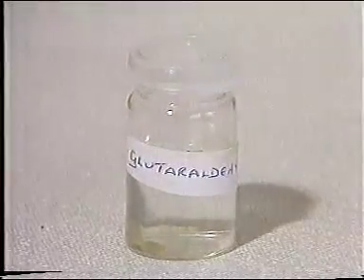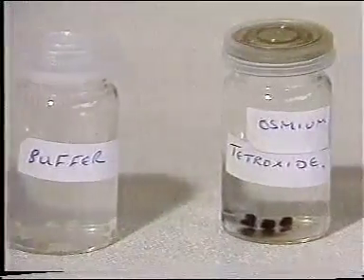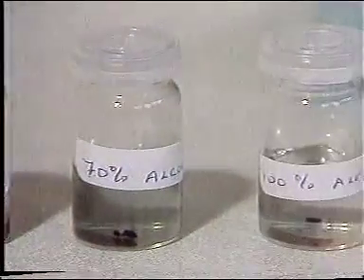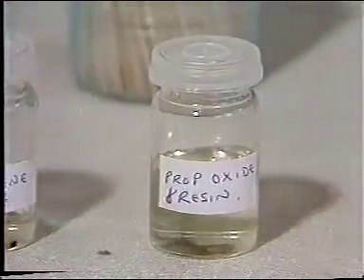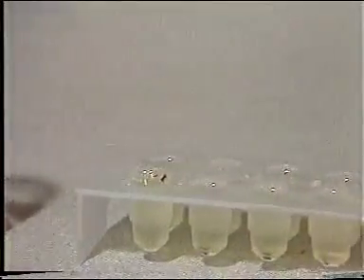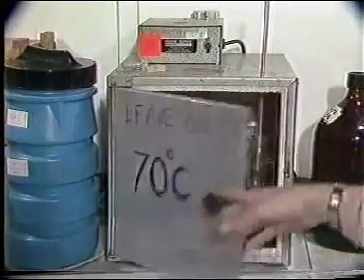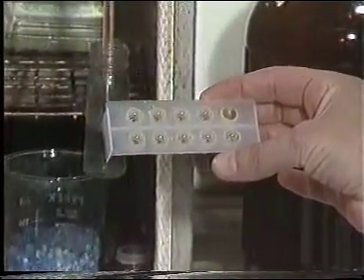Prior to using the second fixative, the tissue is washed in buffer to remove excess glutaraldehyde. Osmium tetroxide is then used primarily to fix lipids. The fixed tissue is then passed through alcohols of increasing concentration. Once dehydrated, it's transferred to resin. It's then put into a small mould and placed in an oven to polymerize. The viscous resin hardens and the tissue, the black material in the resin, can now be sectioned.